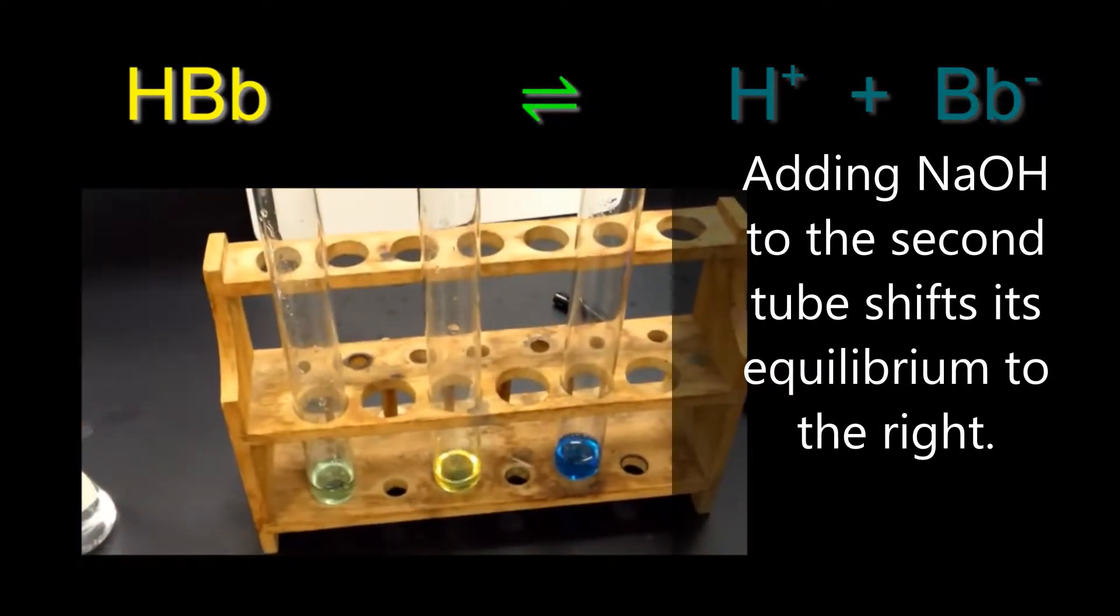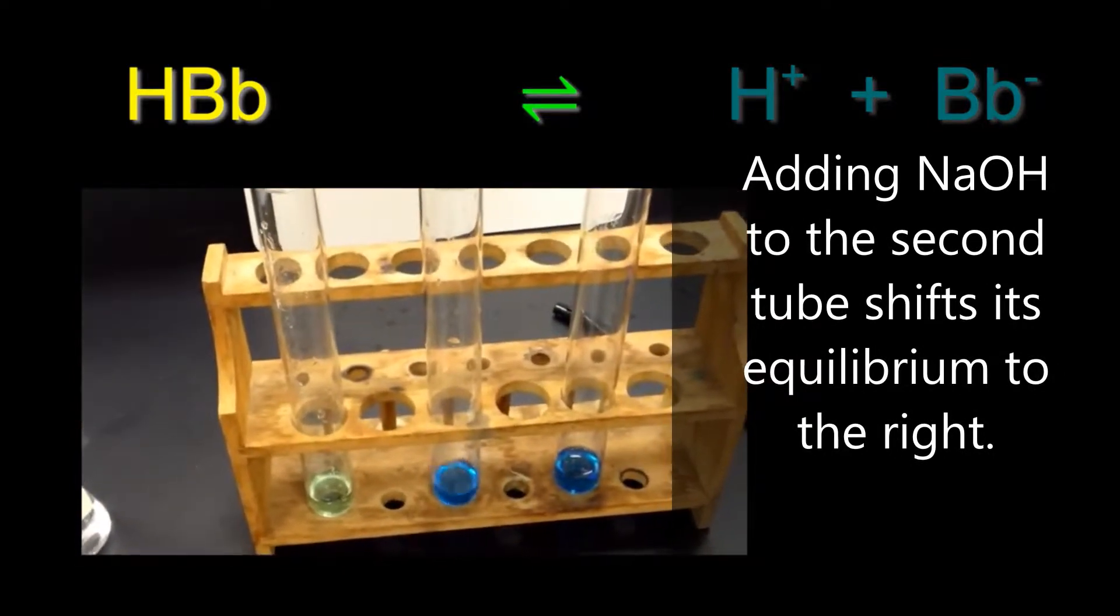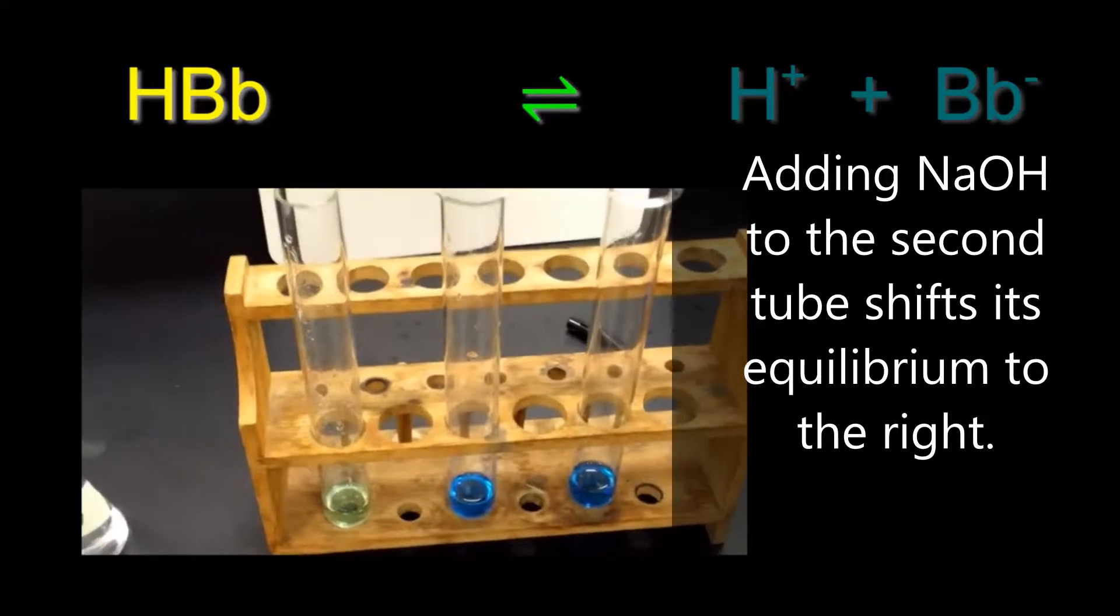If we add additional sodium hydroxide to the second test tube, we can see that the color will turn blue.